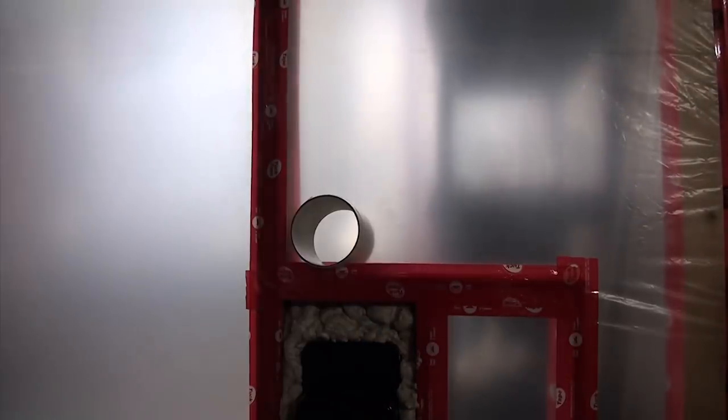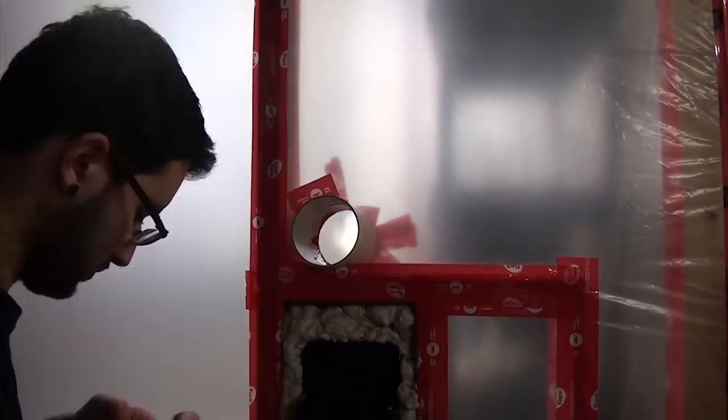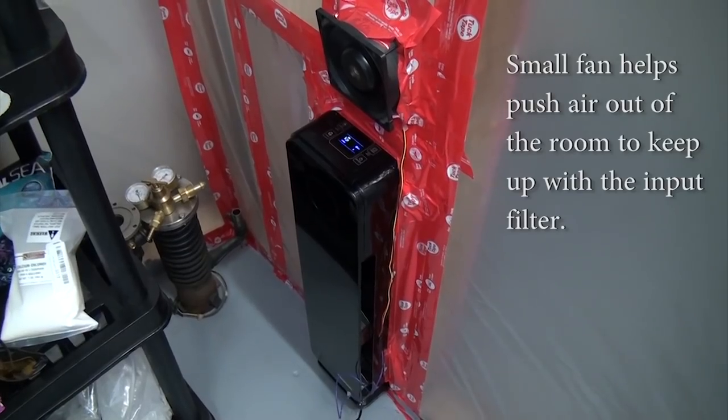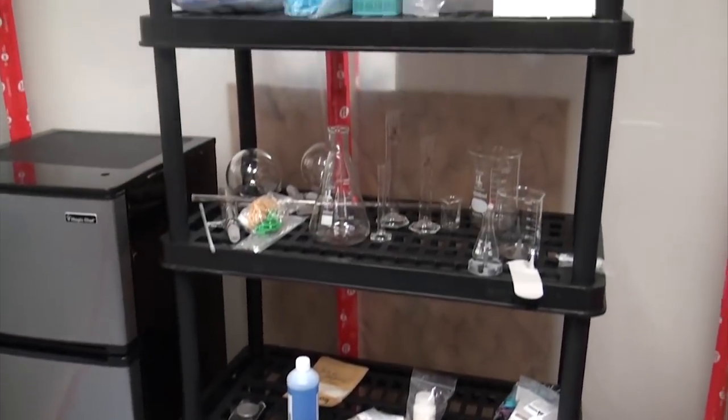To prevent the whole room exploding like an overfilled balloon when we turn on the unit, we added an air exhaust which was made out of some larger PVC tube and capped with a paper filter. This will be replaced by a better carbon filter eventually. There's still a few things missing, but we'll cover those in future videos.